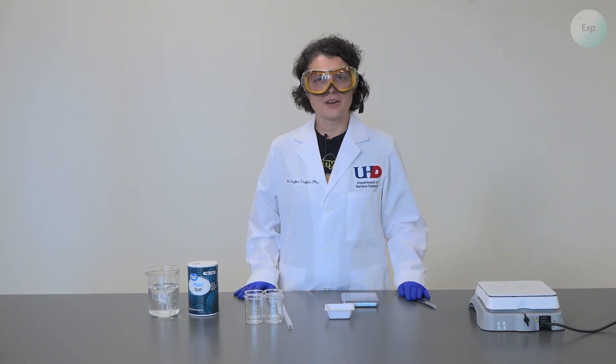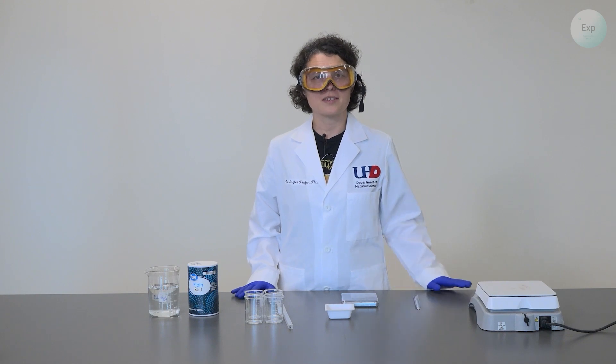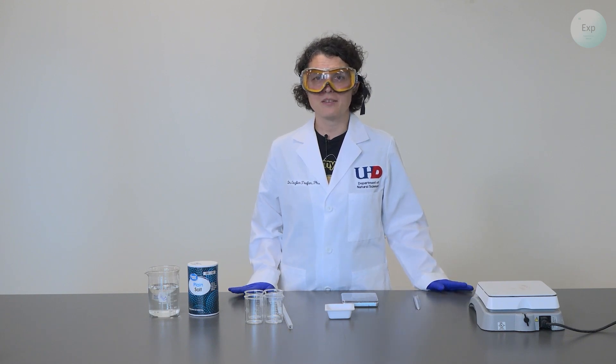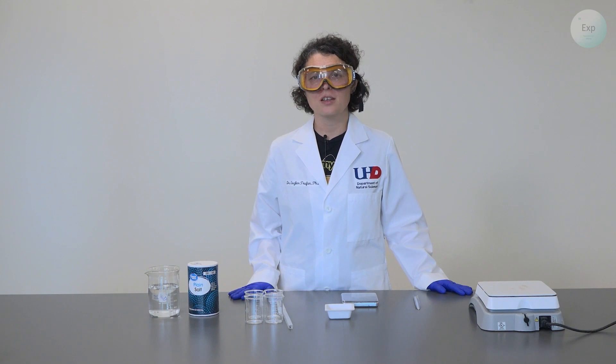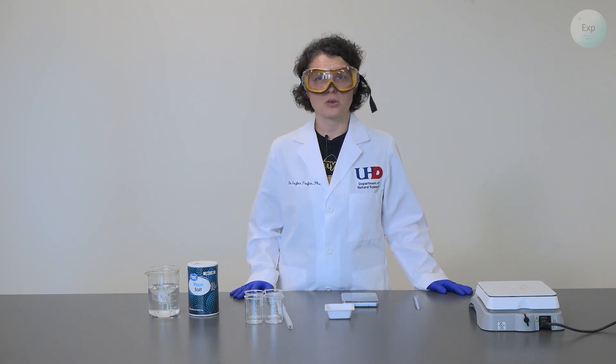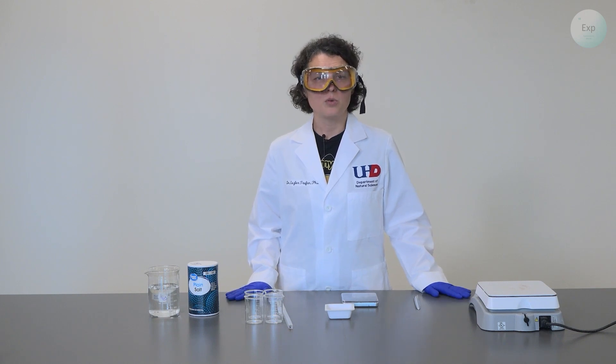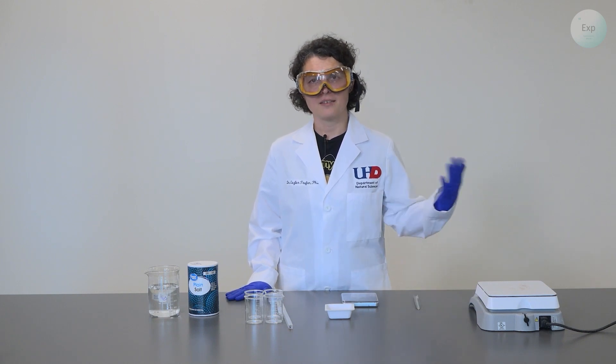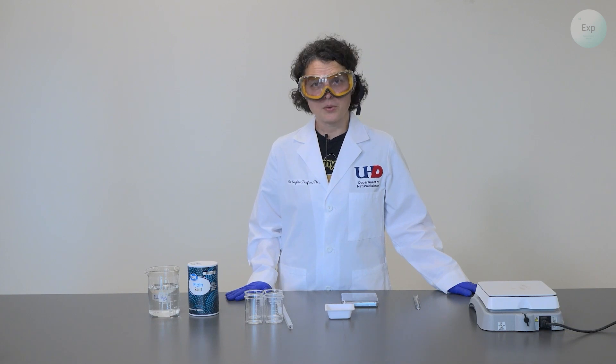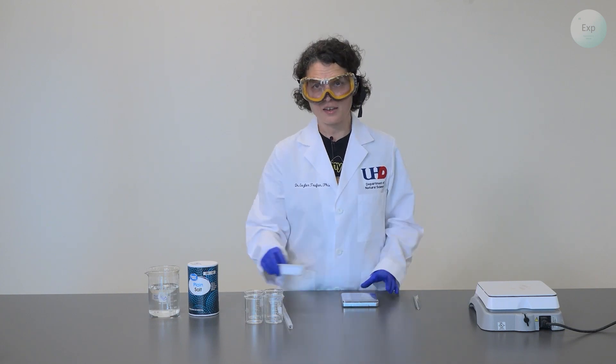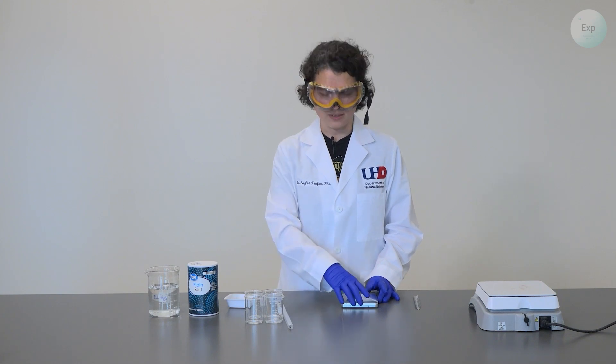We are going to prepare very similar solutions to the ones we made for the freezing point depression experiment. So if you have those solutions ready, you may simply move forward with those, place them on a hot plate, and you're ready to go. But if you are only focusing on boiling point elevation experiments, then you may want to start your experiment like this.